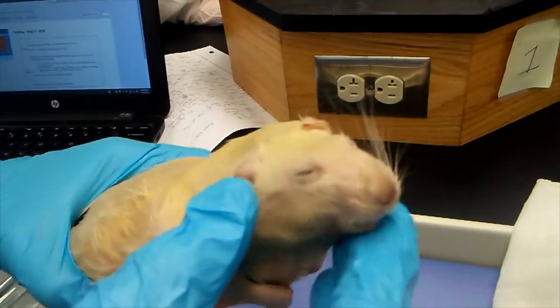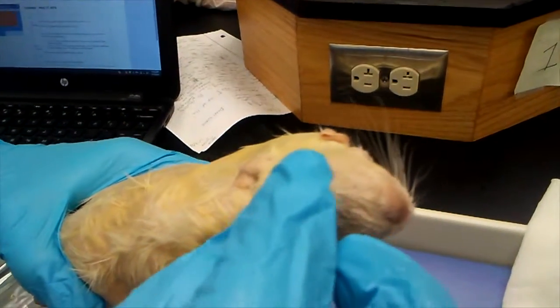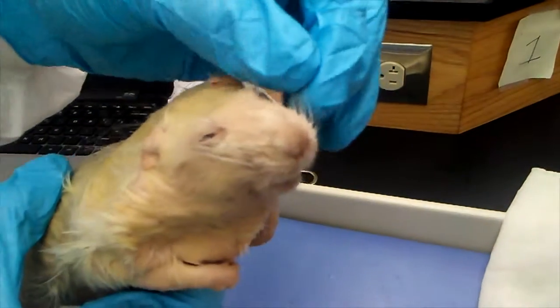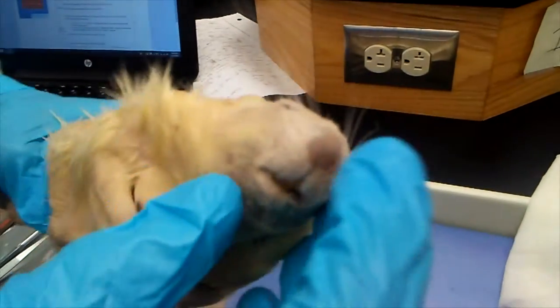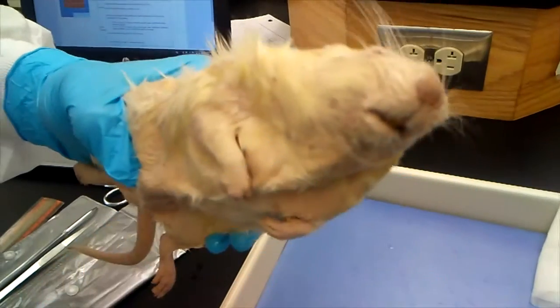The vibrissae of the rat are its whiskers, because they are what it uses to feel, smell, and touch everything — to make sure that everything is okay for it to eat and how it feels and senses its environment.